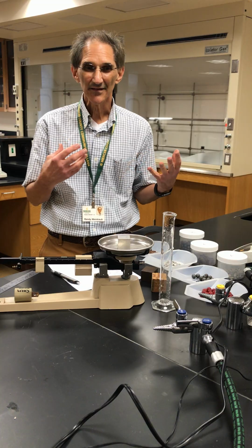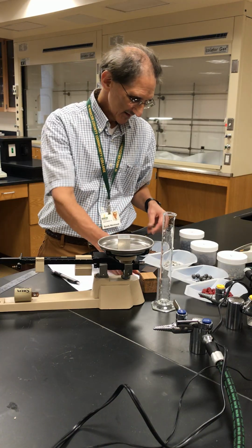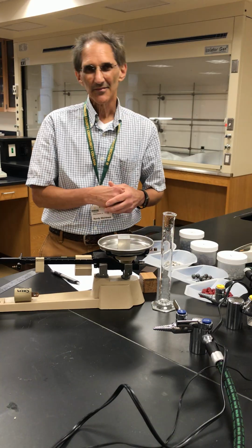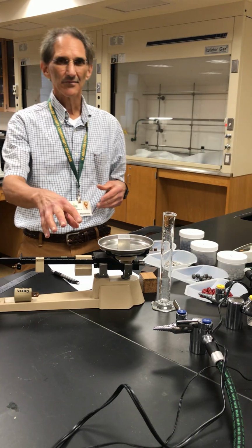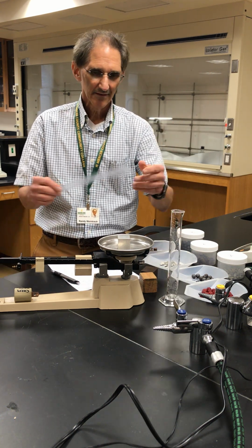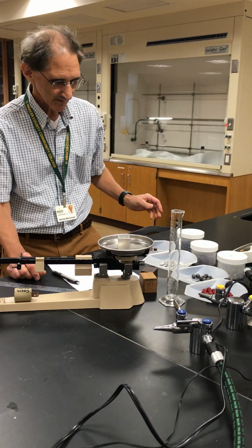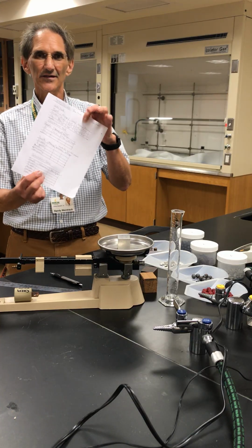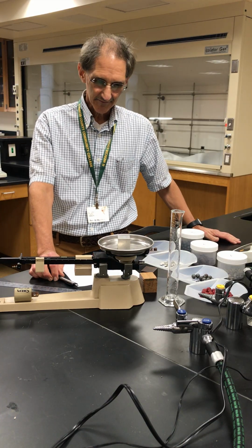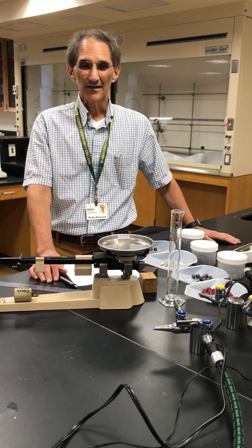You have a density, I have a density, this aluminum block has a density, this wood block has a density, these various shapes of copper have density. And today in the lab, we're making use of a triple beam balance, a graduated cylinder, and a ruler to determine the density of various objects. And I have my data sheet here. I'm going to share my data with you so you could do the calculations and answer some questions and do some wondering about this quantity of density.